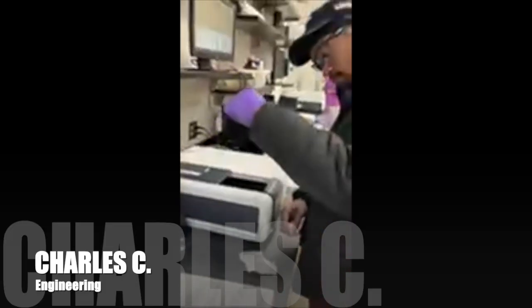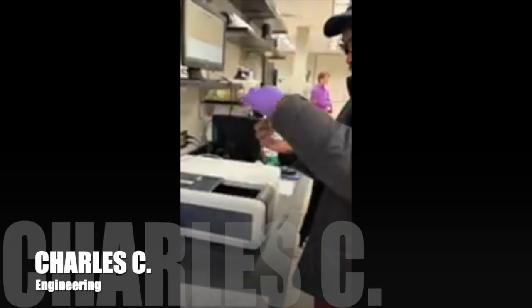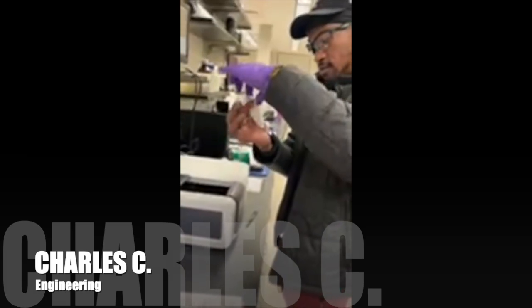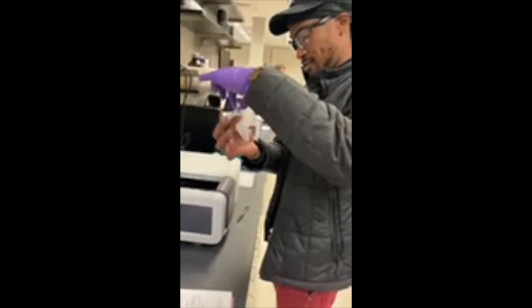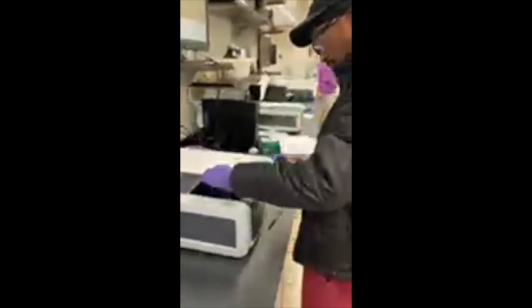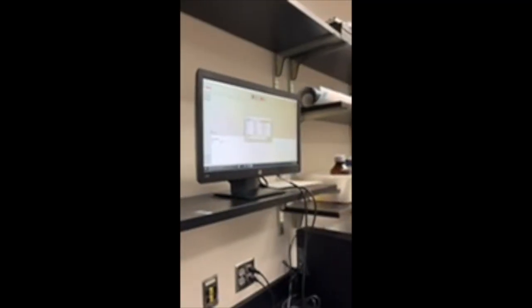Again, here we wipe the clear sides of the cuvette to remove fingerprints that could affect absorbance. The cuvette is placed with the clean sides facing the beam and the lid is closed before scanning. We scan across all wavelengths to determine the lambda max, which is the wavelength where absorbance is highest.